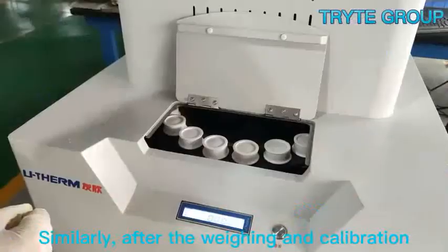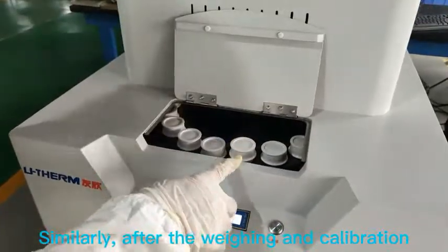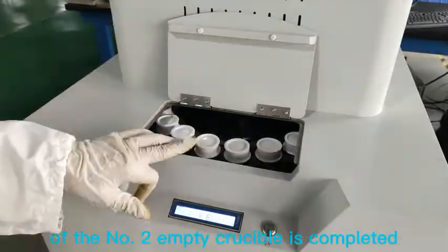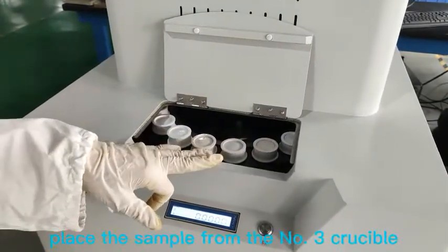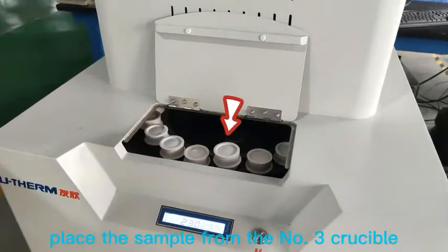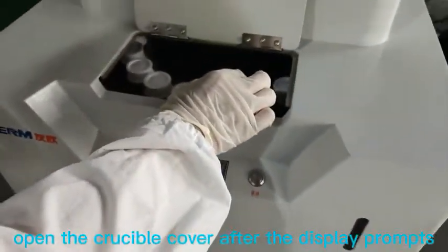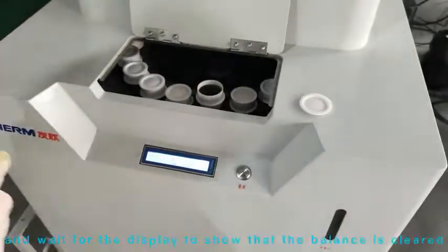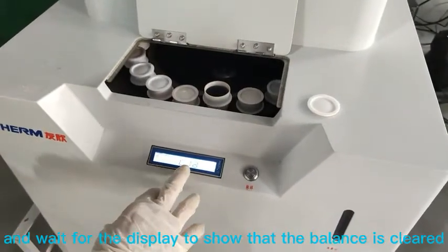Input the serial number of the sample to be measured, complete confirm, and the volatile tester starts to run. After the weighing and calibration of the number two empty crucible is completed, place the sample from crucible number three. Open the crucible cover after the display prompts.